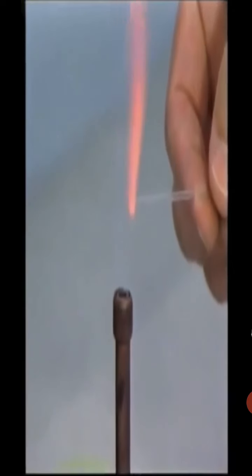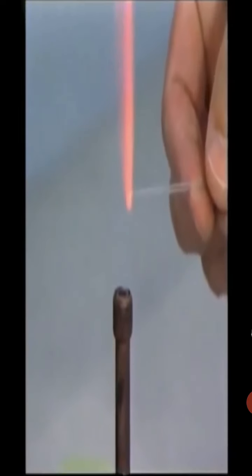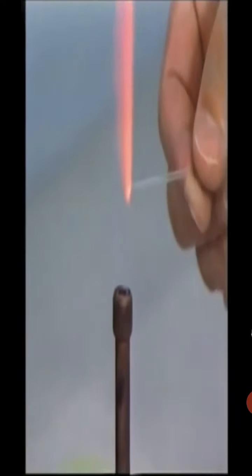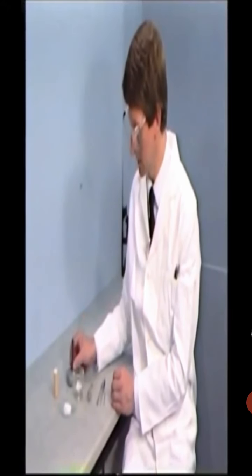The sample tube for melting point measurement needs to be sealed at one end using the Bunsen flame. Hold the tube in the edge of the flame and rotate gently between the fingers. The blob of glass quickly seals the end of the tube. Don't leave the tube in the flame over long. The blob will become too large and will prevent insertion of the tube into the melting point apparatus. Always remember to return the Bunsen flame to the yellow position for safety.